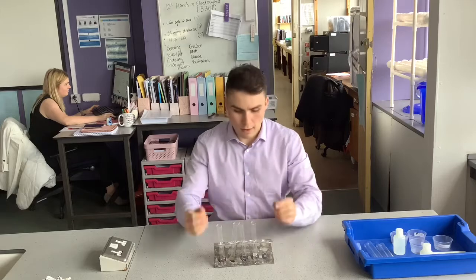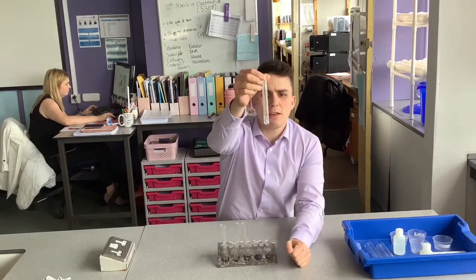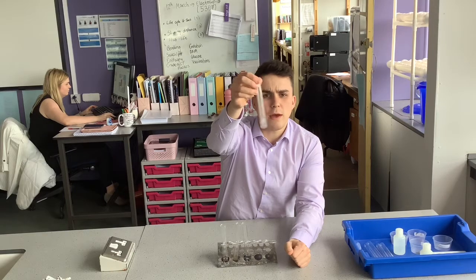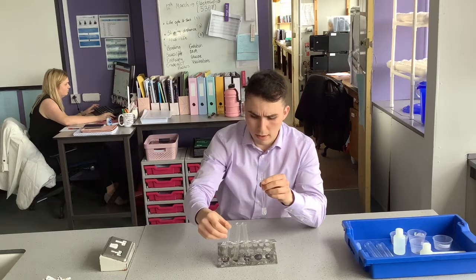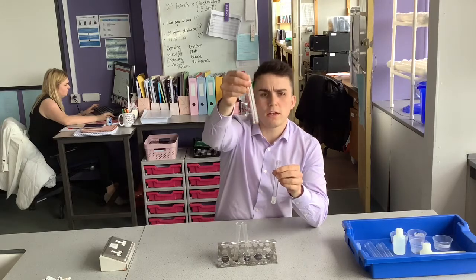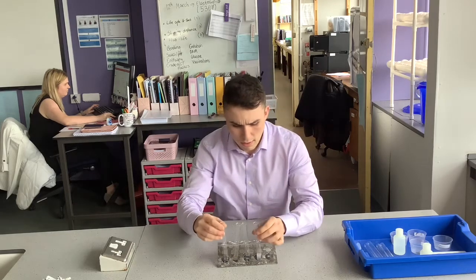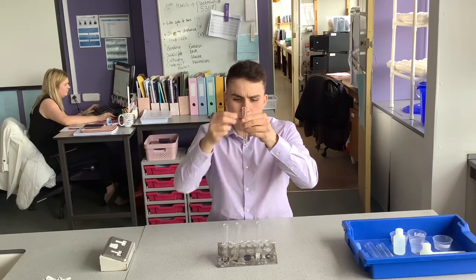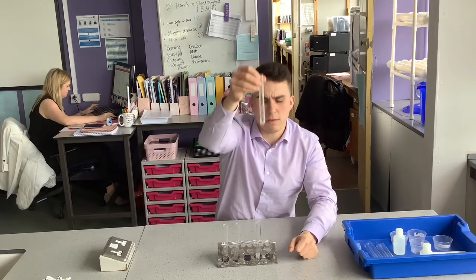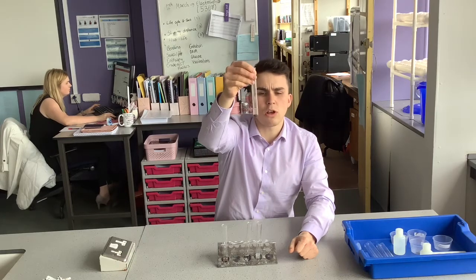First thing you will notice is that magnesium has bubbled almost straight away and it is fizzing. Whereas copper, down the other side, just looks like he's having a bit of a rest really. Nothing is happening at all. And then in the middle, we'll see that there are slight bubbles for zinc. I hope you'll be able to see that. And finally, some iron. Not a lot is happening.